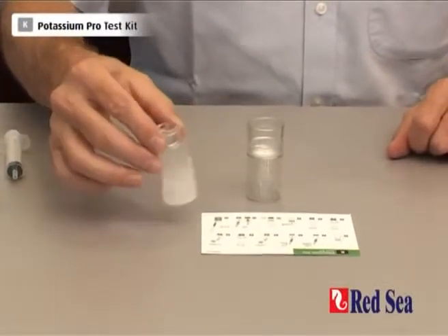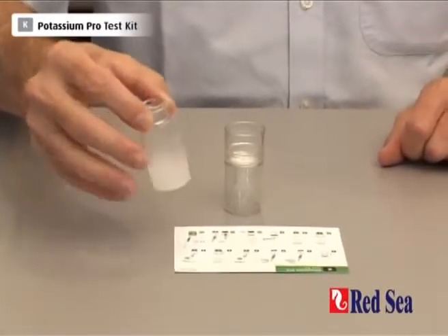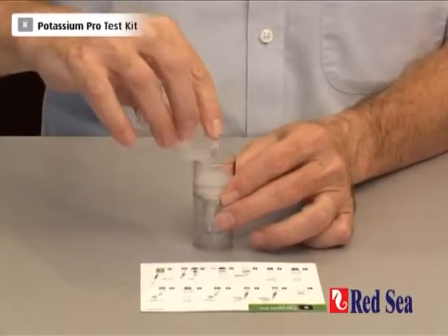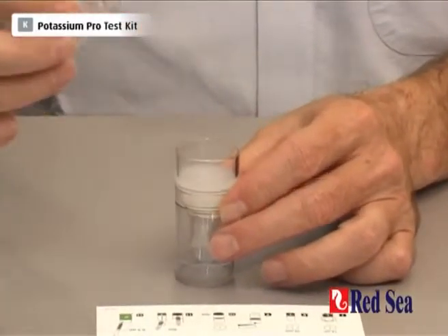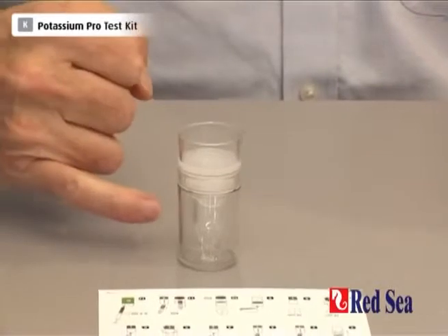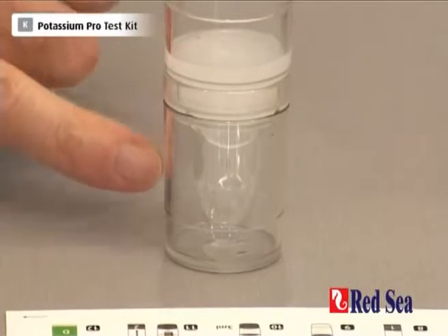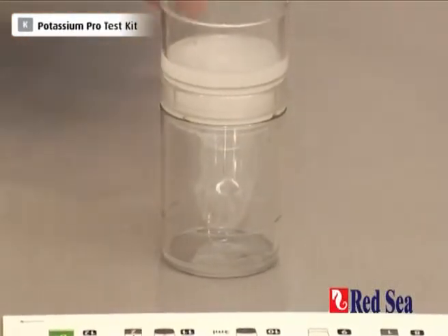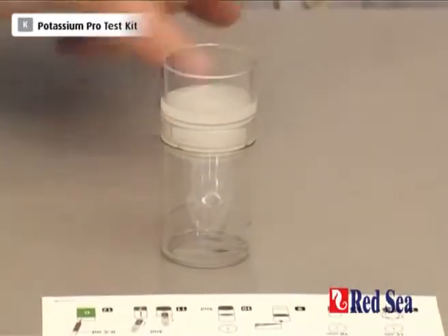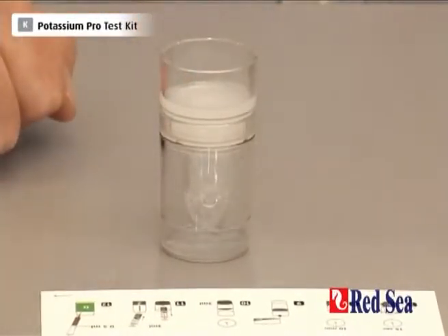10 minutes has passed. Give the vial a little swirl to make sure everything is in solution, and pour the liquid into the top of our filter unit. Leave that for about another five to seven minutes while the liquid drains through. When the filtration is finished, we're going to use the liquid that comes through at the bottom. What we need is 3ml of this liquid, and there is a line around the base of the cup showing exactly where the 3ml quantity is achieved.